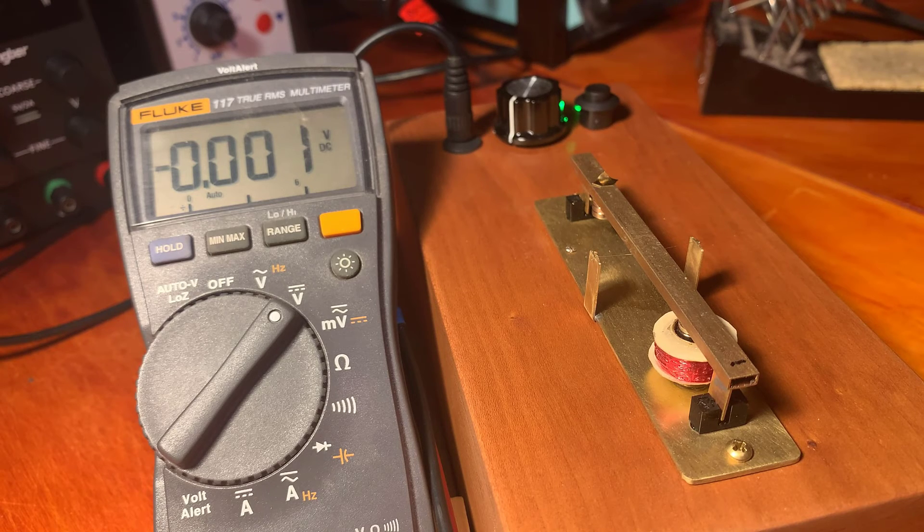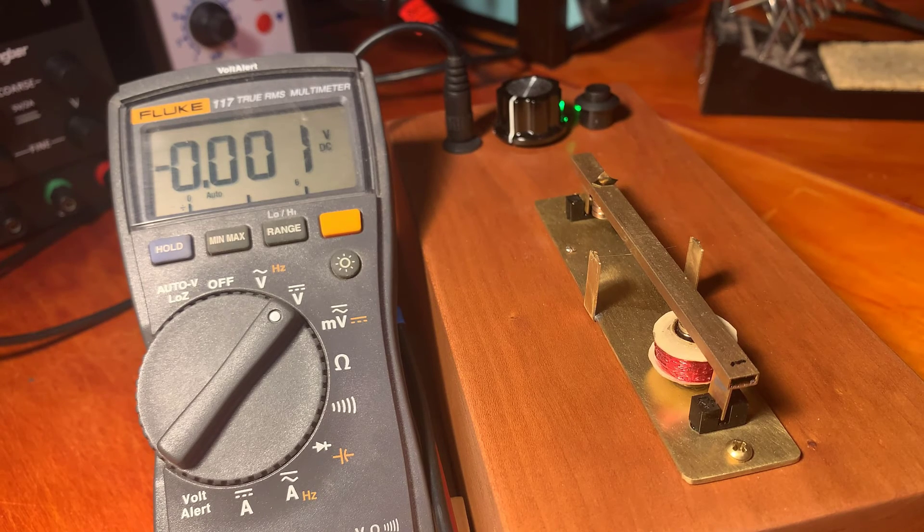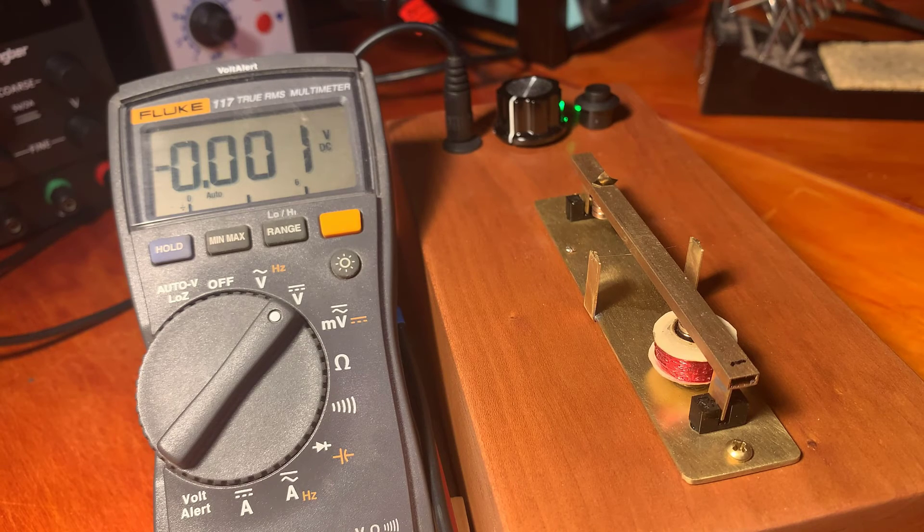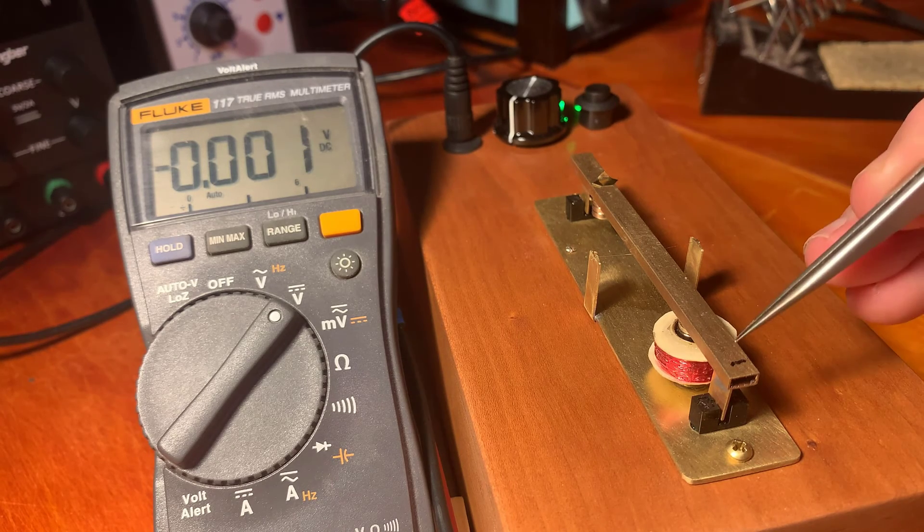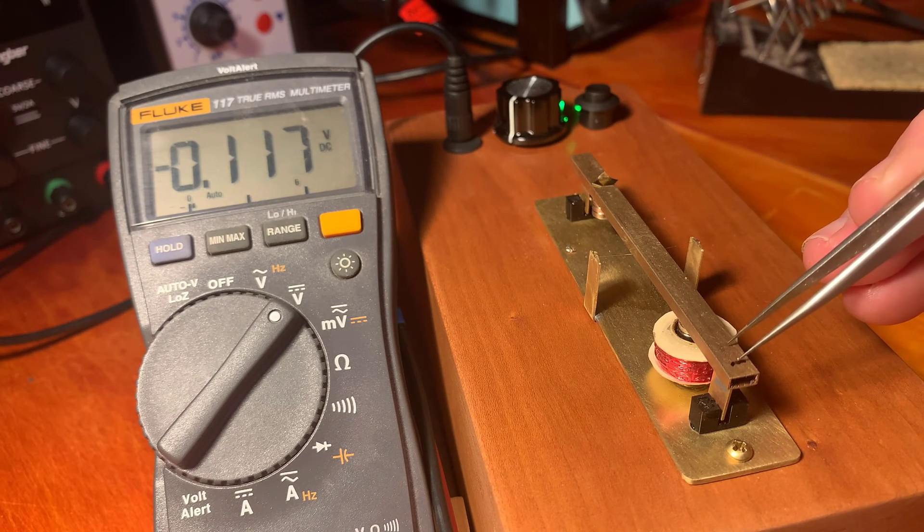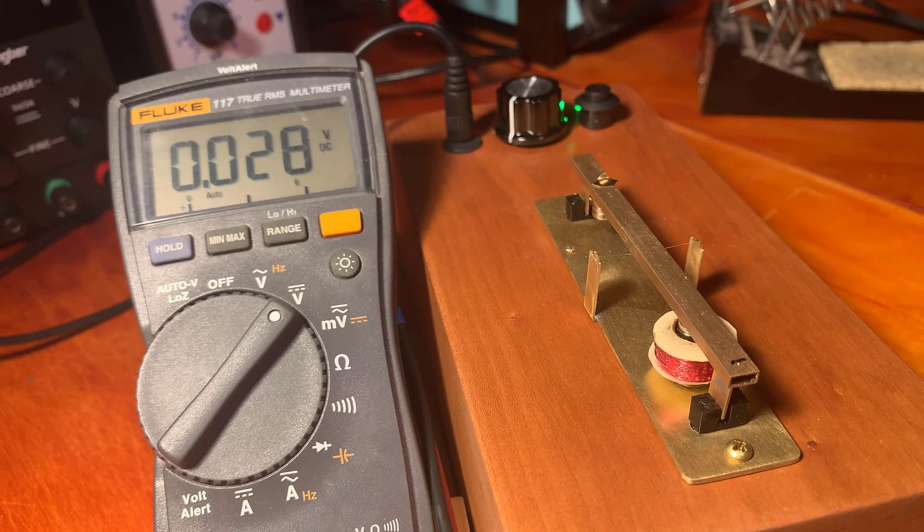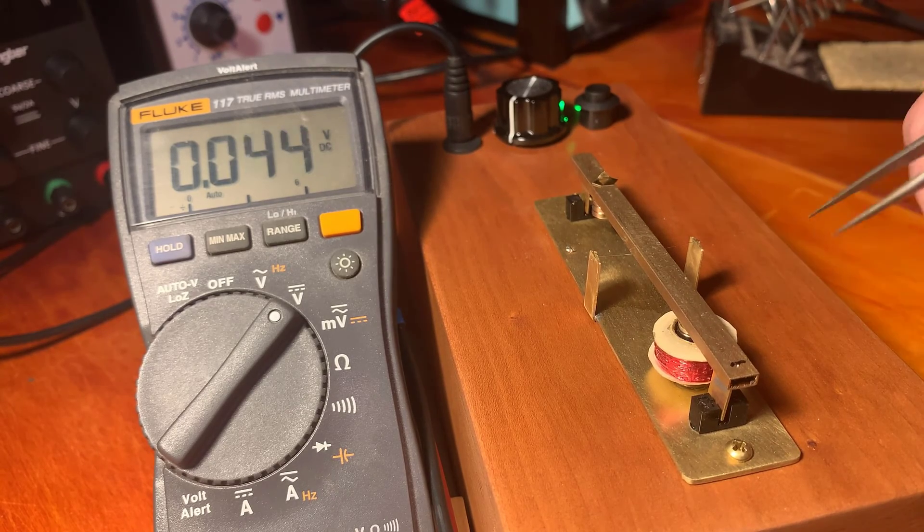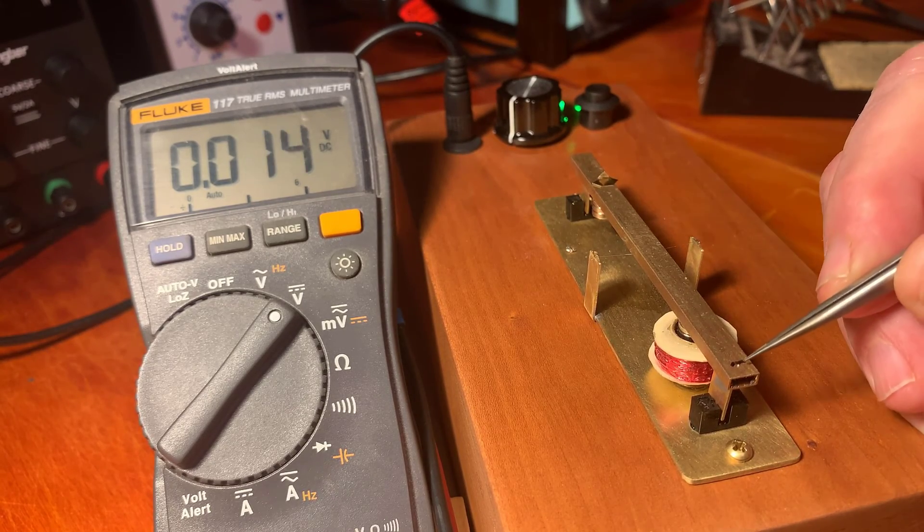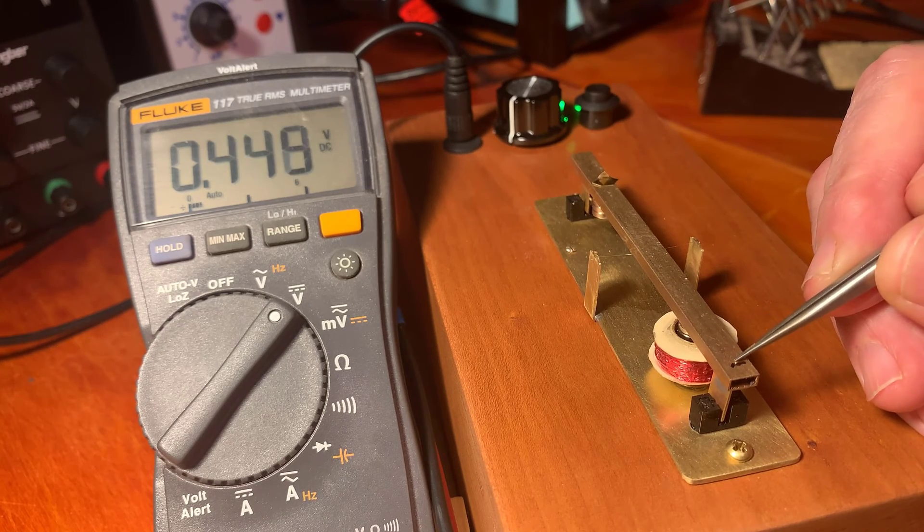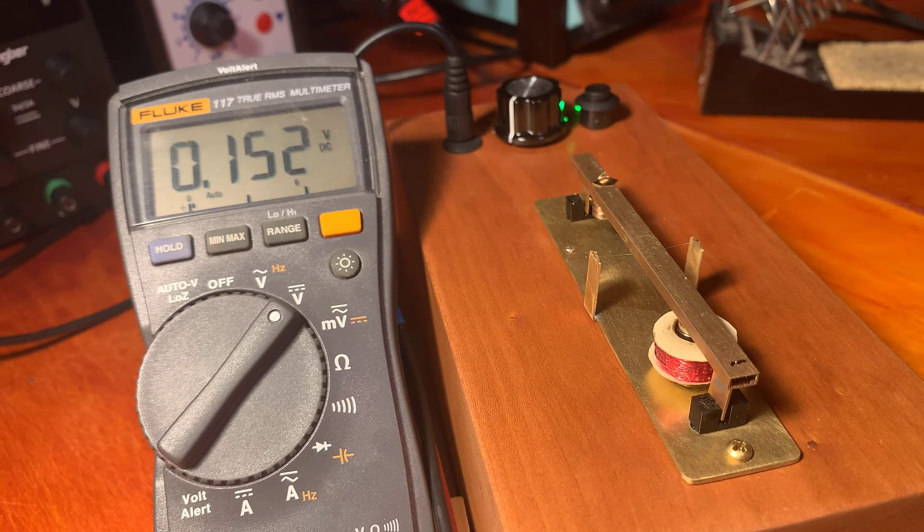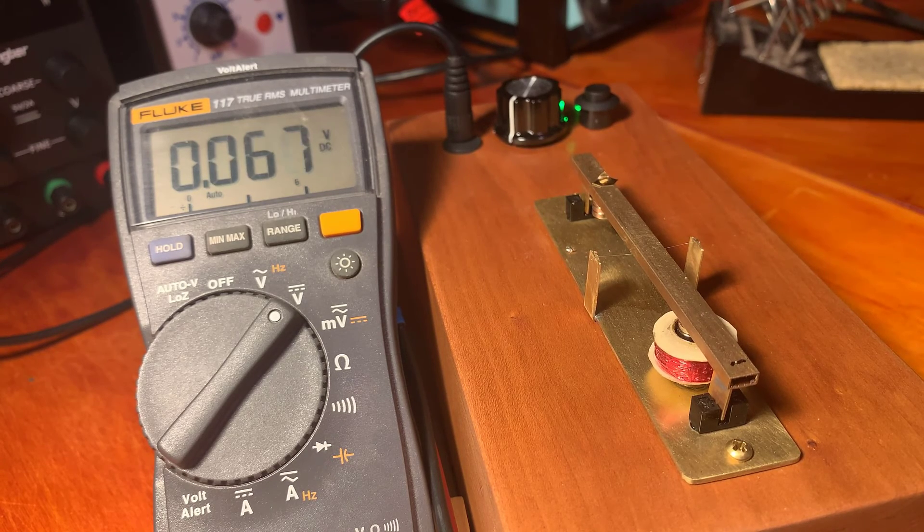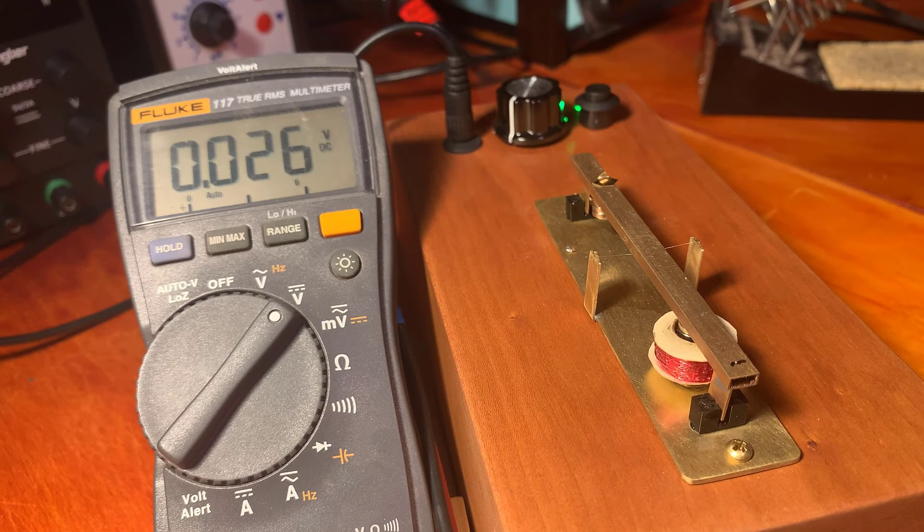The tweezers tend to, if you pinch too hard, the gold ball flies away. And the other problem is they get stuck on the tweezers. And get that right on the black line. And we're going to let it settle.